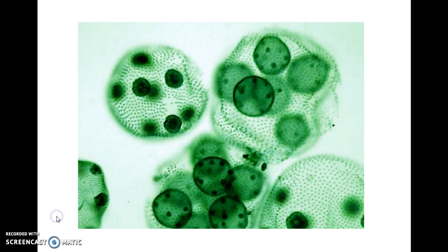And you'll also be asked to get the width of the letter E. And again, you would use the grid slide to do that. Once the grid slides are out, make a measurement of the width. How big across is the letter E? Okay, for the next slide, this is algae, Volvox algae. And when you look at this, we see these kind of little green spheres. The fact that it's green should give you a pretty good indication of what kingdom of life the algae is in. And then again, you'll be asked to try to estimate the diameter of one little piece of algae going from one side to the other. And again, you'll use the grid slide to do that.